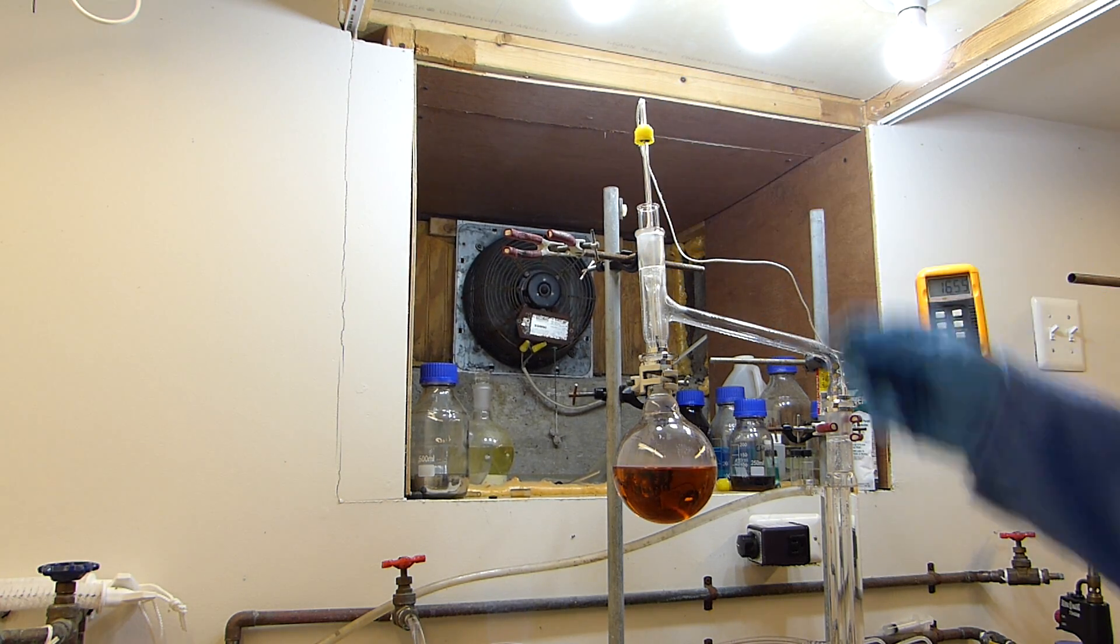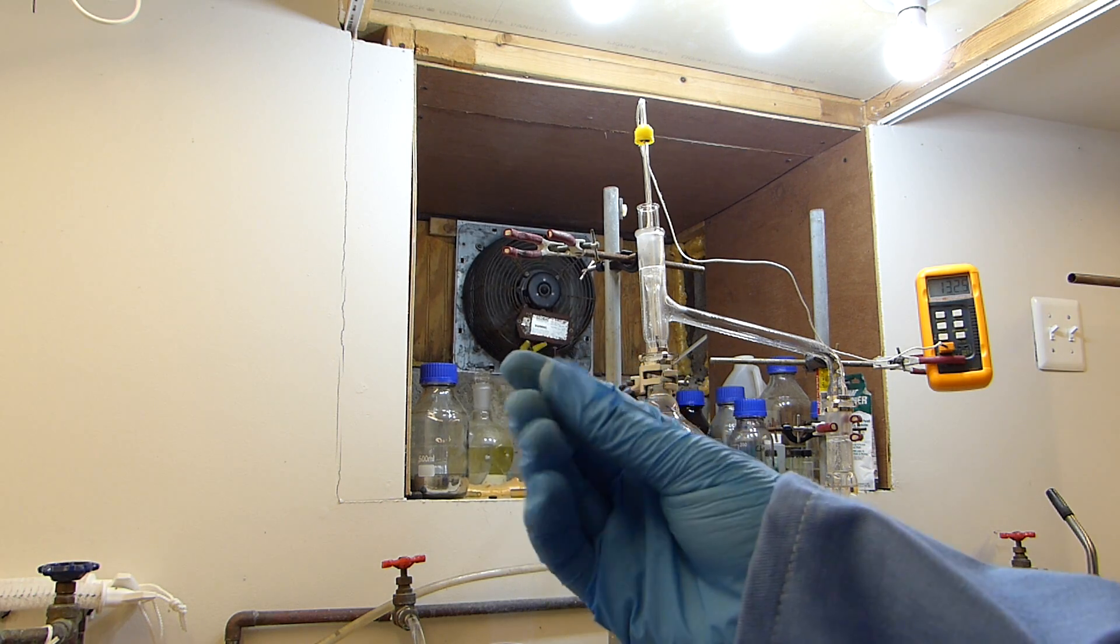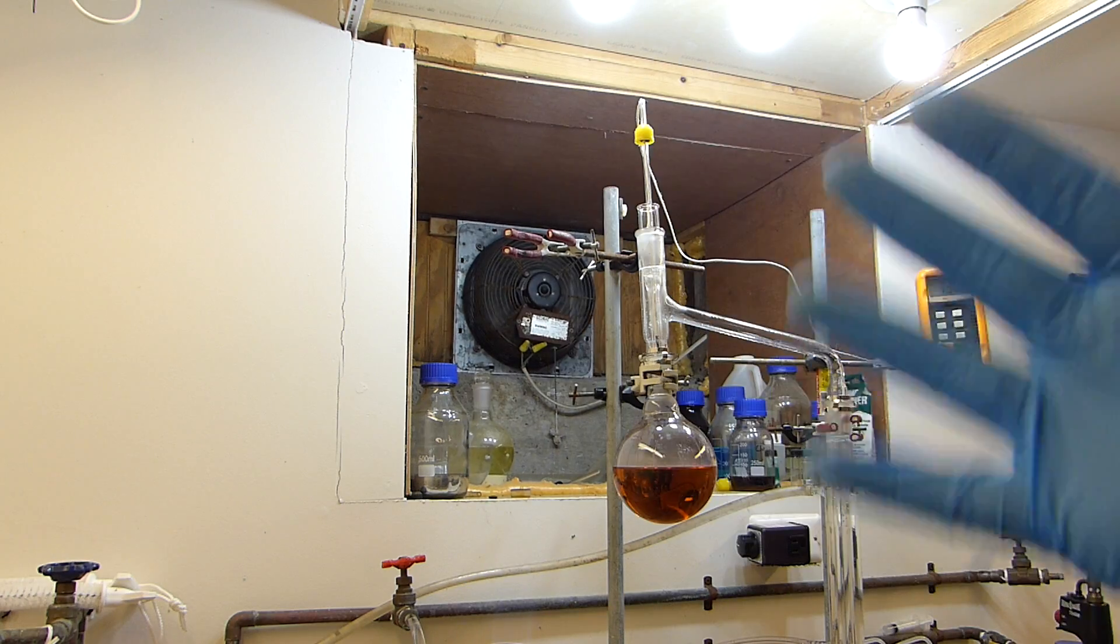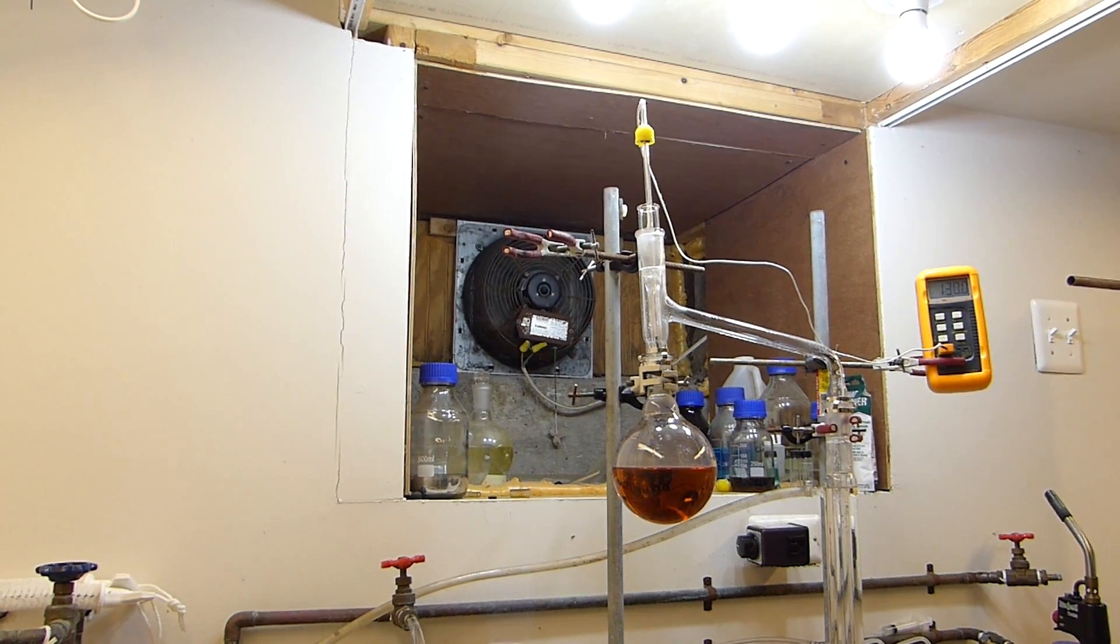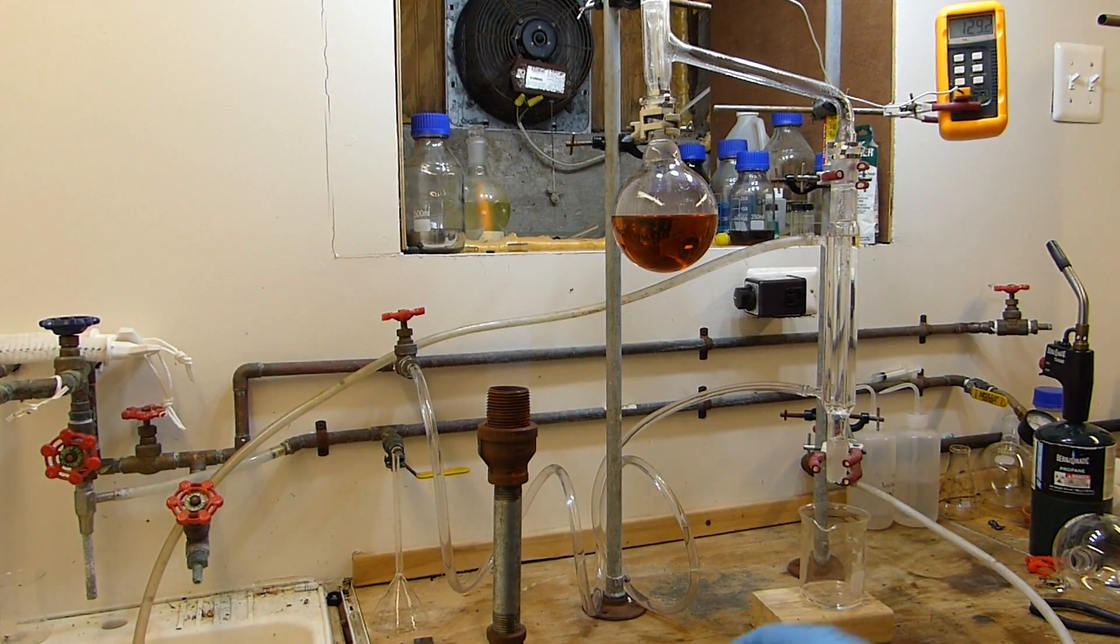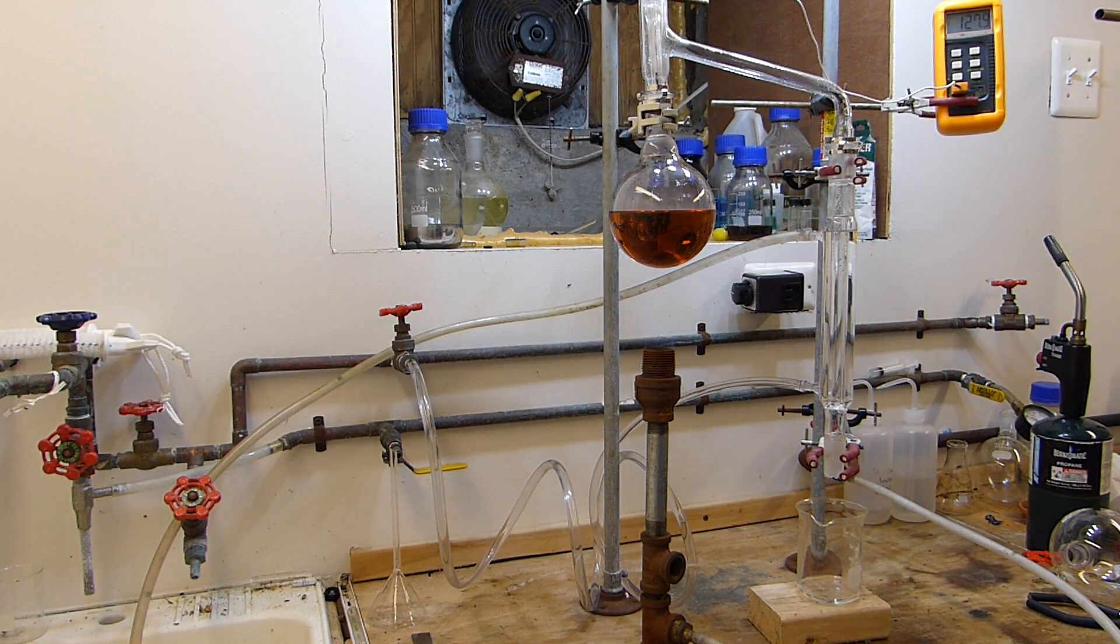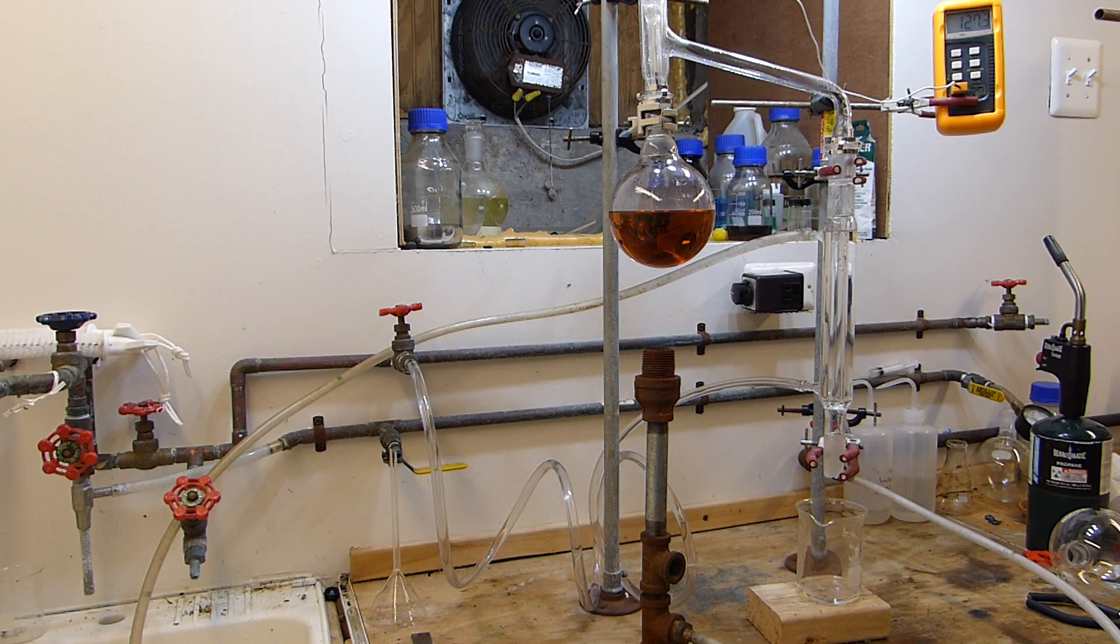You can see how sulfuric acid makes a great joint grease, and obviously I got to be careful not to touch that because it'll get acid on my fingers and it's really easy to not notice that until you wipe your clothes or something. It'll put a hole in your clothes, it'll burn your skin, obviously be very careful. So I'm going to put the flame back under that and resume this distillation.